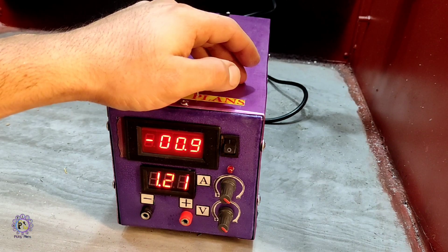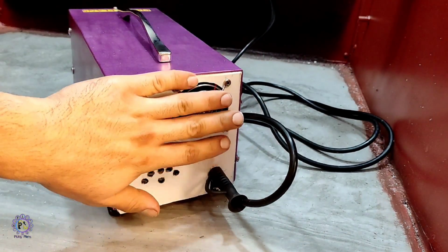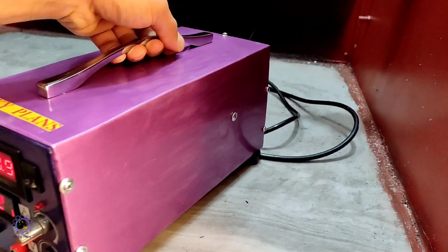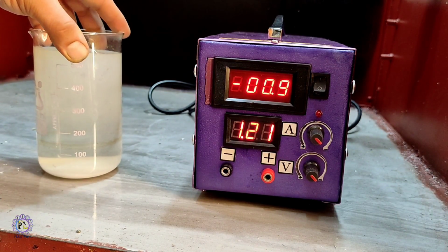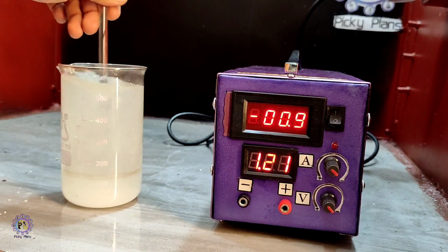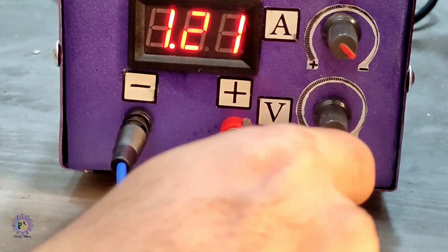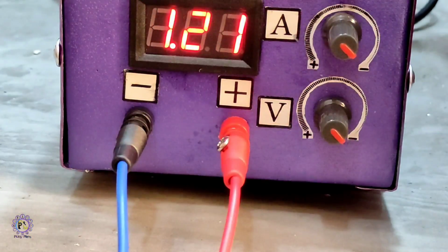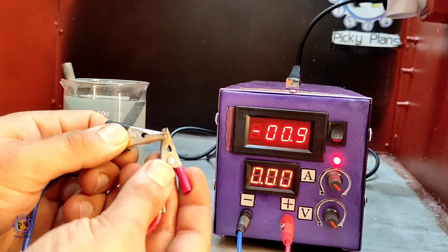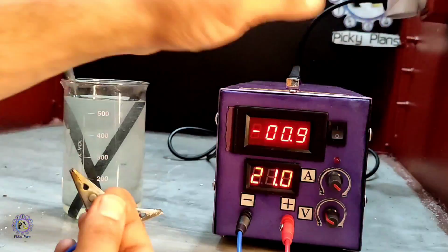Alright, it's done and seems great. I think it's a good idea to test it practically to see if it works. So I made a concentrated table salt solution to start electrolyzing. Next, I placed electrodes into the beaker. Before I start running it practically, I decided to test the short circuit protection.